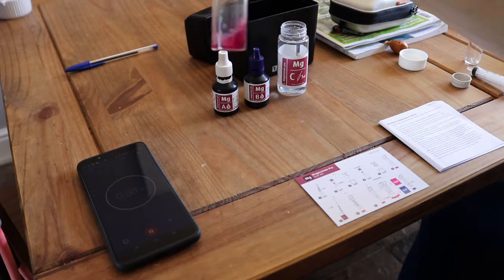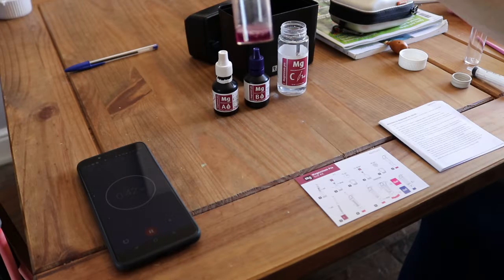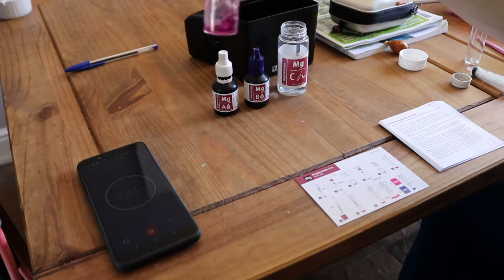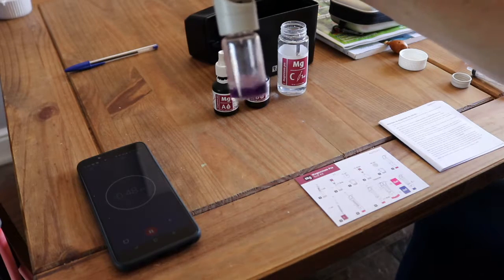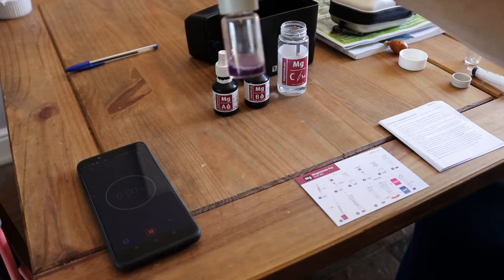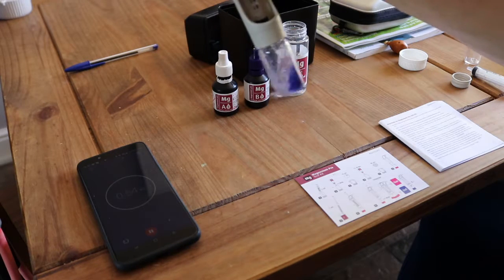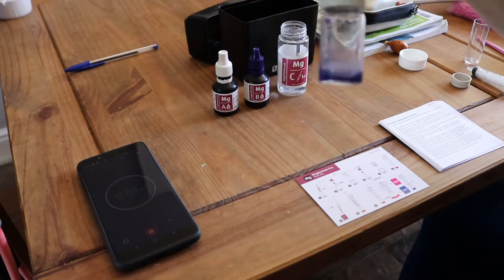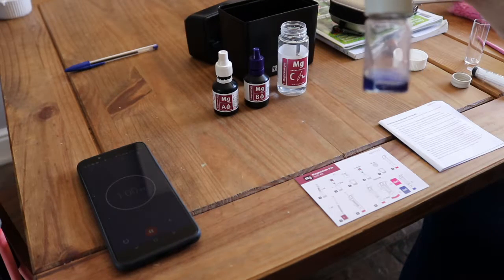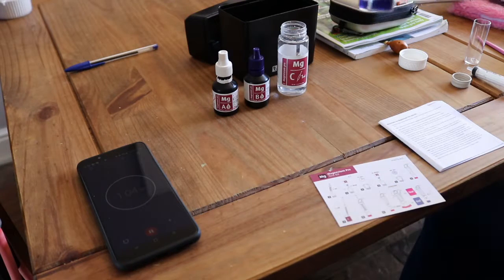And then what the key is, see, that's definitely going a darker purple now. We're up to 40 seconds on the test. Another drop. So it's going purple. See, that's definitely purple now, but obviously you keep going. And the idea is you keep going until you first see the blue. And that is the first, that is blue, okay? And we are at just over 7 used. It's probably 7.2. Don't know what this is off the top of my head yet, so it's 1440.